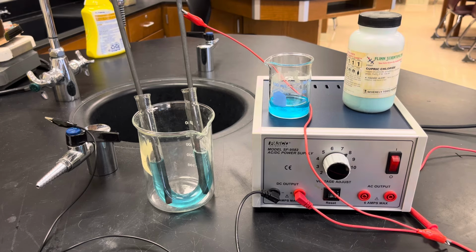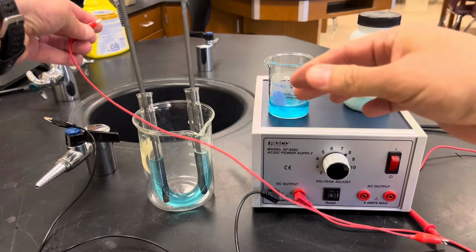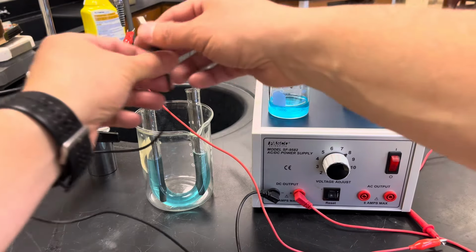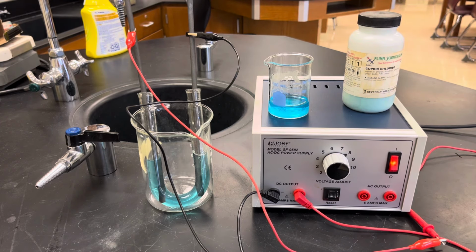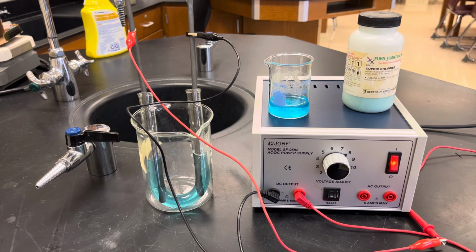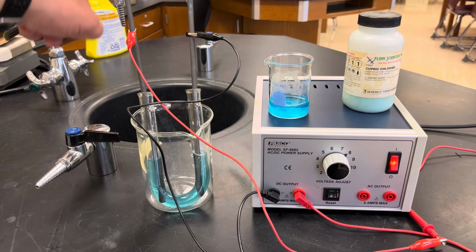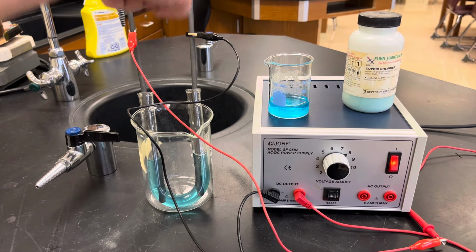And my question would be, well, what happens if I simply force the electrons in the other direction, okay? And making this one hooked up to the red one, and this one hooked up to the black one, and let it go for a little bit. Now this might take a while, but the copper was over here on the left-hand side, okay? And if I let this go for a while, hopefully we see that copper go away, okay? And hopefully we start to see some bubbles on the left-hand side, because the left-hand side is now hooked up to the red side. And then hopefully we see some copper production over here on the right-hand side, because that's where the copper was being produced.